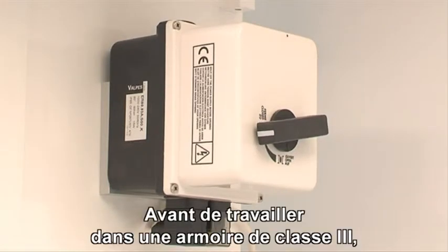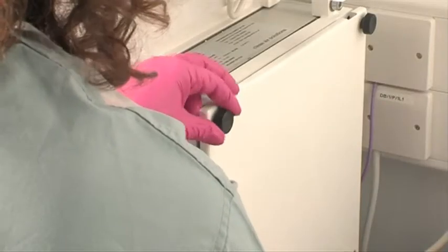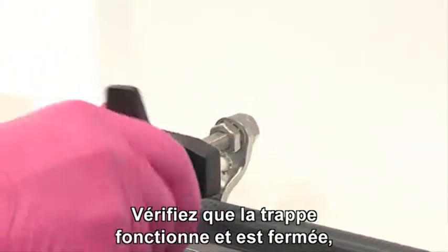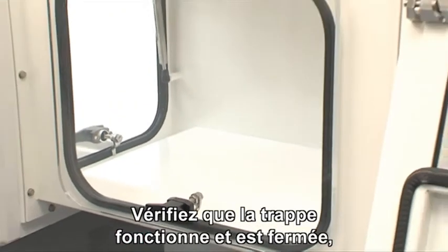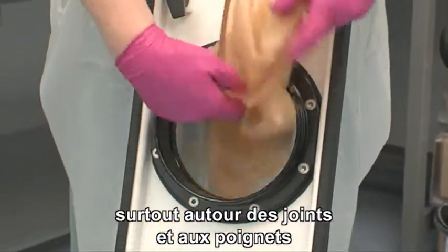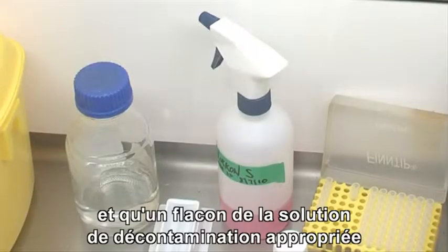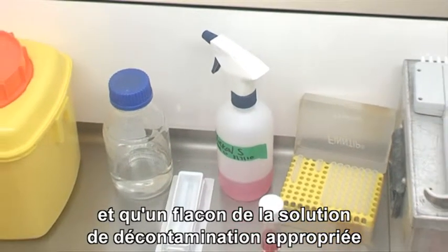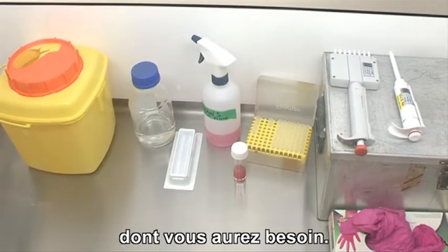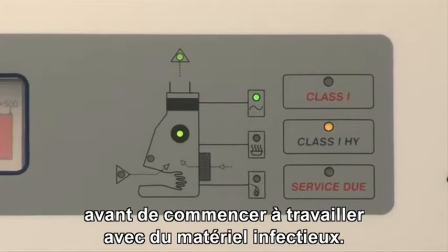Before working at a Class 3 cabinet, make sure all dampers are in the correct positions and that all necessary air intakes are open. Check the pass hatch is fully operational and closed. Check that the integrity of the gloves has not been compromised, especially around the seals and at the wrist cuffs. And make sure there is a bottle of the appropriate decontamination solution placed inside the cabinet along with all the equipment you're going to need. Make sure the pressure dials are in the safe working zone before you start any infectious work.